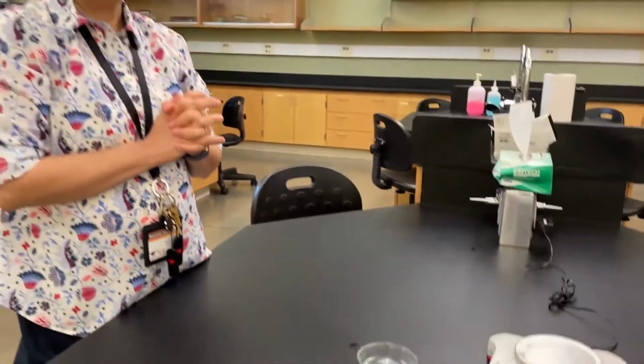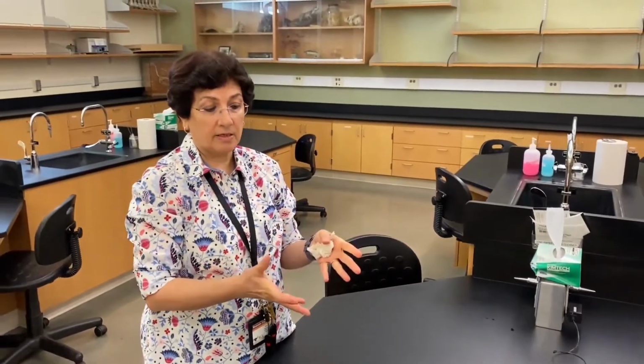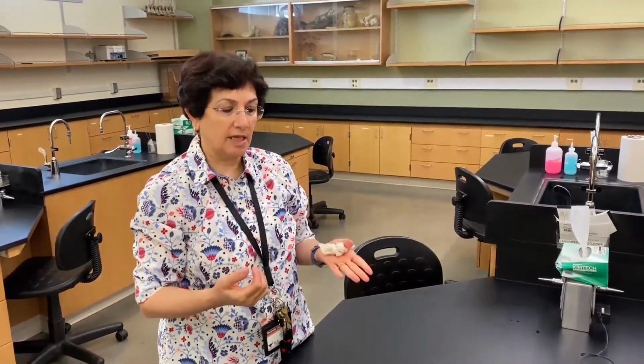What do you think? Well, the beaker has no solutes in it. It has no starch. It has no sugar. So in this case, what would you think of the movement of water? Is the water going to go inside the dialysis tube or is it going to leave the dialysis tube? Based on what you learned about osmosis in lecture, my hypothesis is the water will move inside the dialysis tube.